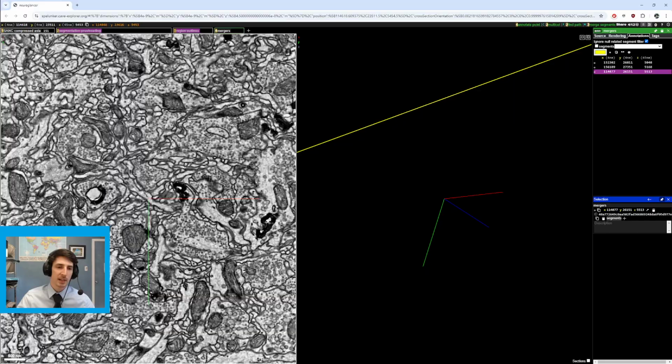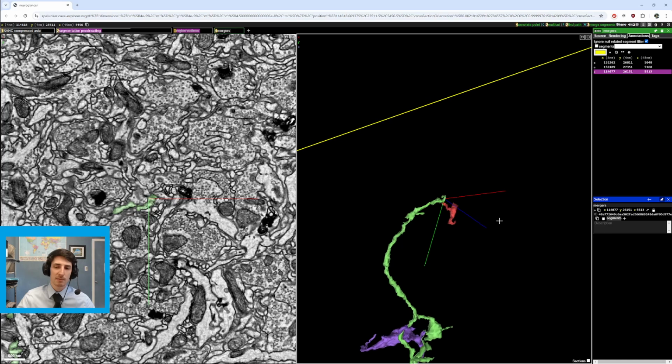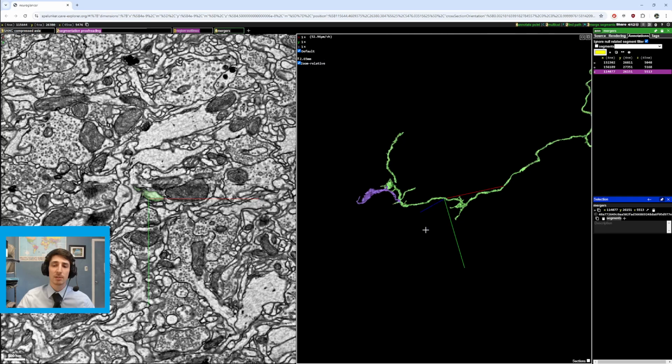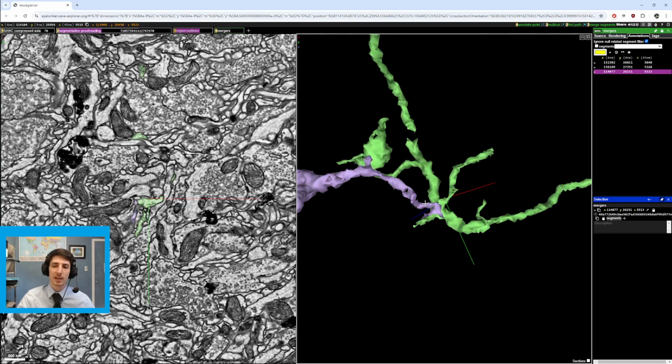That also looks like a merger. And I believe that this actually doesn't really go that much. But because I was already in this cell, I decided to just give it a general proofreading, and I was able to find 3 mergers. So the first one is here. I'll just get rid of this.